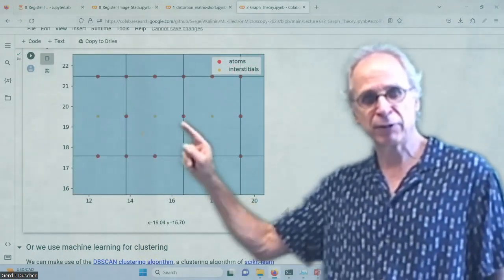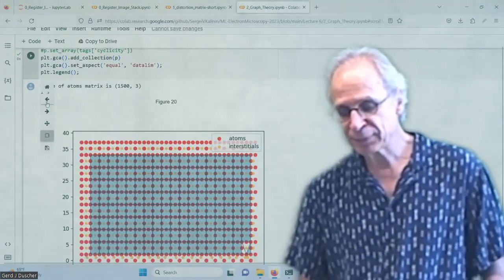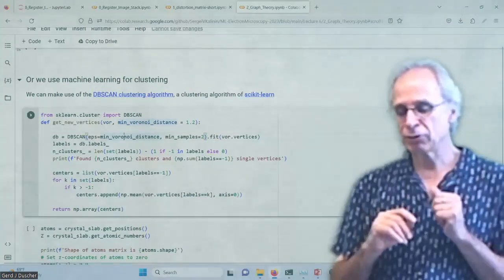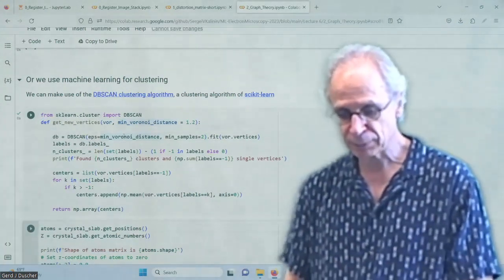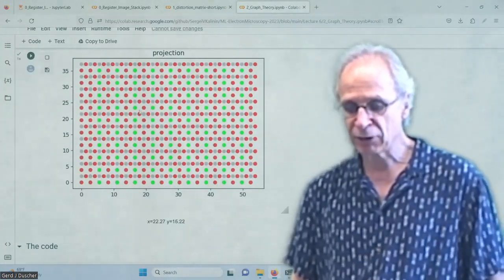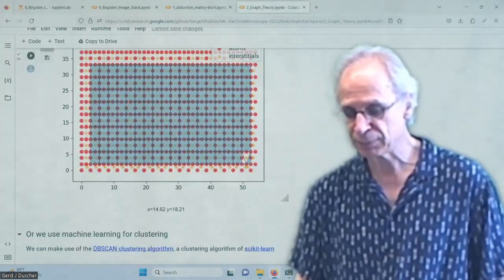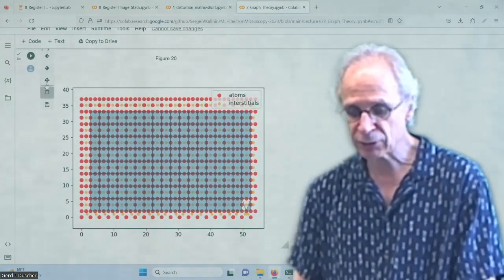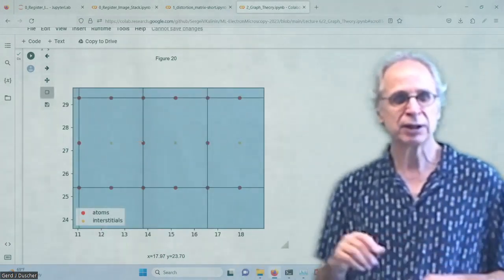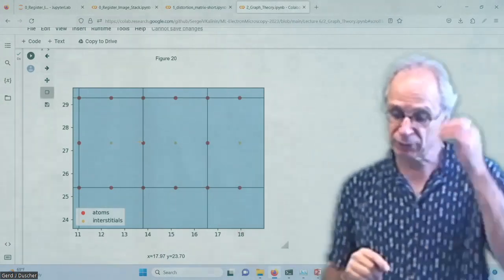Right? And I get my ring, get my bonds. Everything nice and easy. Okay. There are a lot of different Voronoi positions in here. So actually, for each of the cells, I think we have 6 or 7 Voronoi graphs. So here's one, there's one. Okay, so there are many of those.